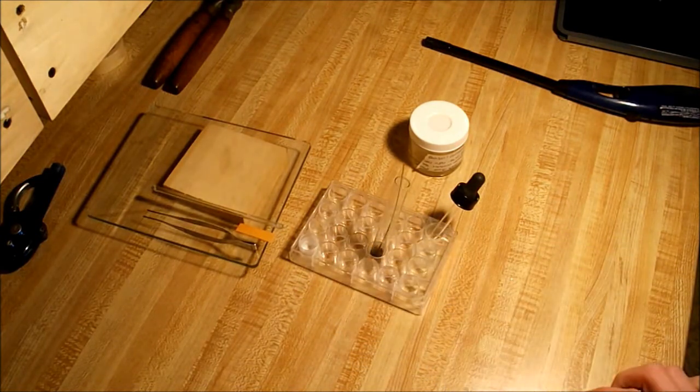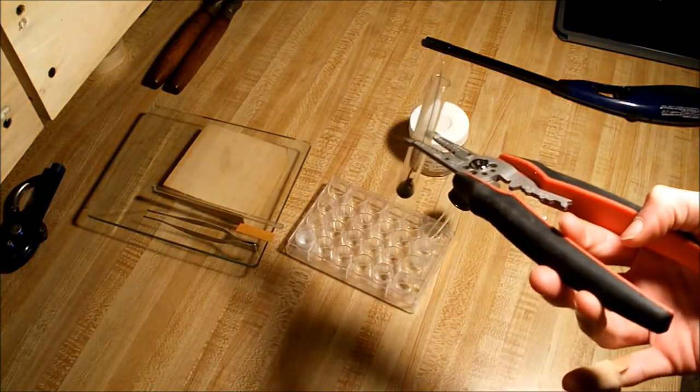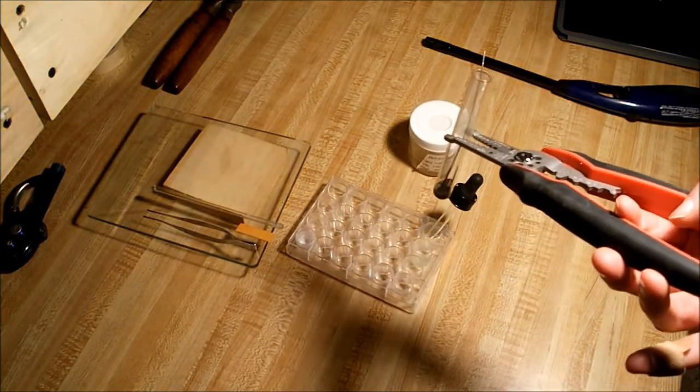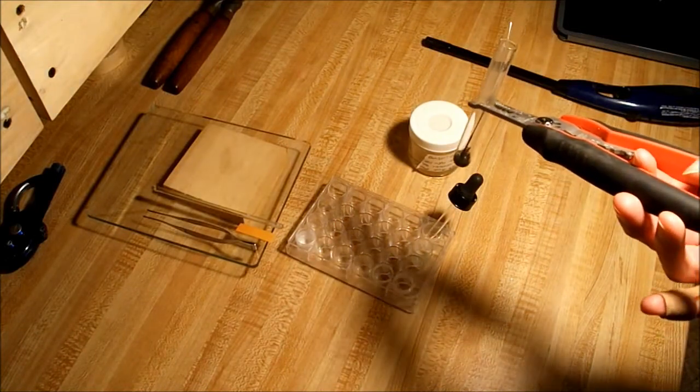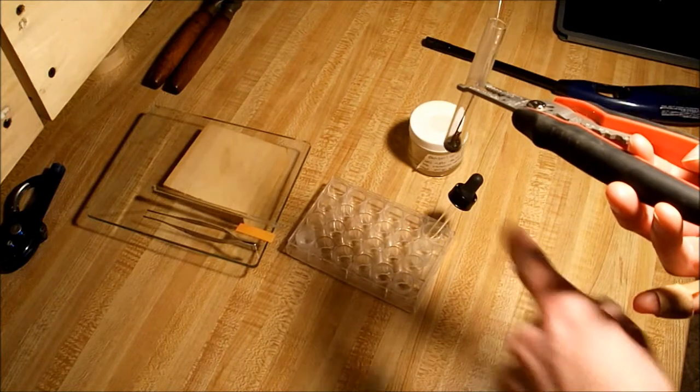As you can see, it does not like that acid very much at all. And as you can see, there's already copper forming on the aluminum wire.